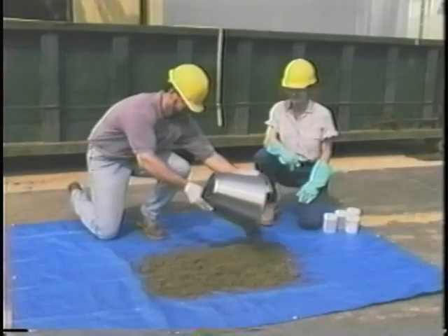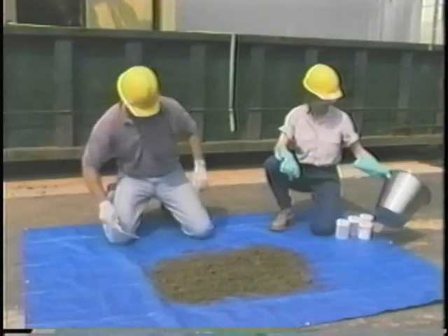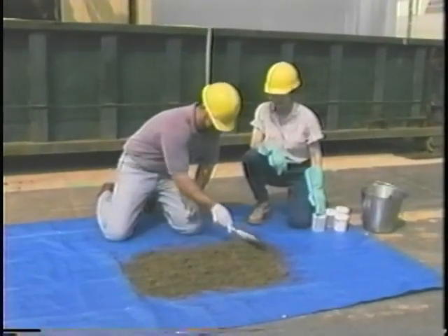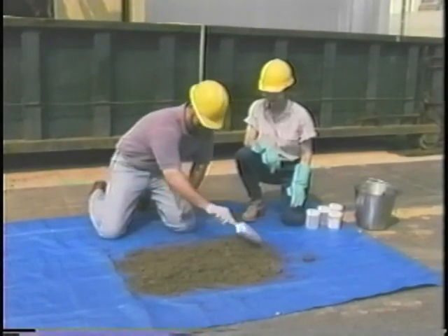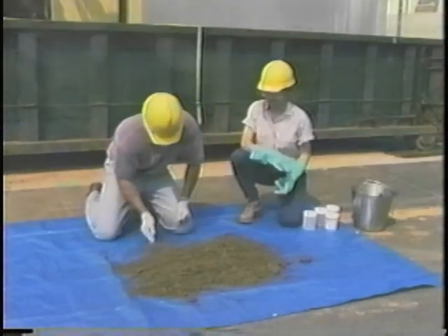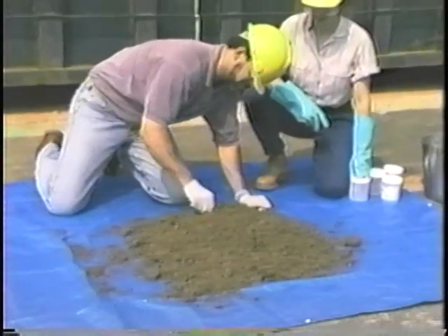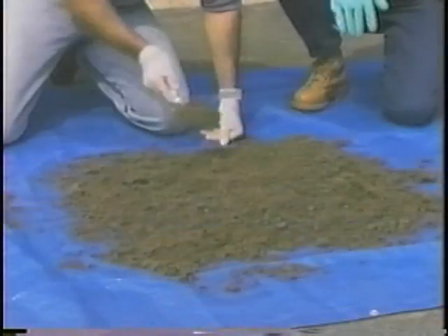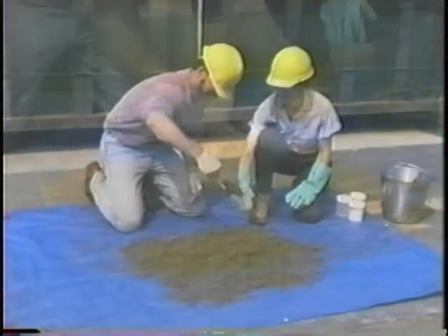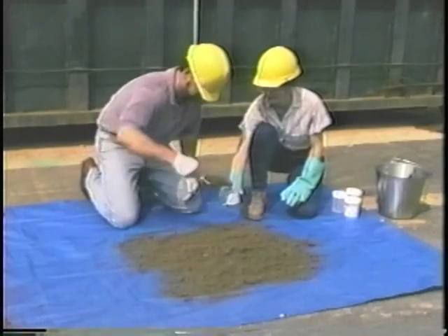Again, for a composite sample, the aliquots need to be mixed thoroughly to ensure that the sample is representative of the entire bin of sludge. When the sample is too large to mix in a bucket, you can mix the sludge on a plastic sheet. There are a variety of mixing techniques. This one involves layering the sludge, folding it onto itself, and mixing. This 2-step process is repeated 5 or 6 times before filling the sample containers. We will demonstrate another mixing technique for large volume samples later.